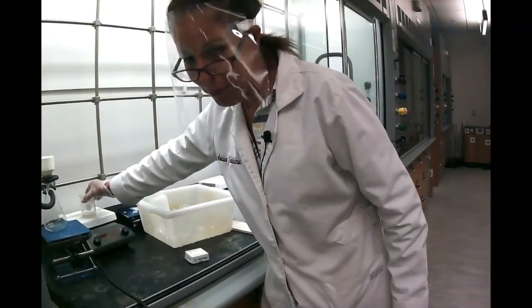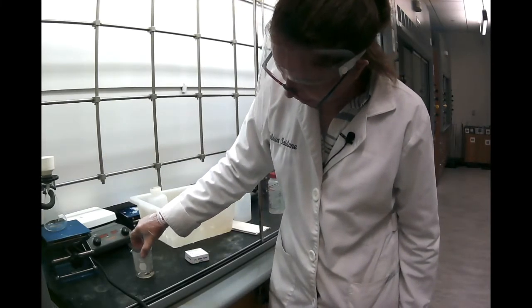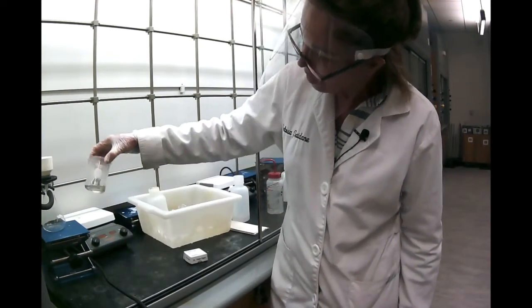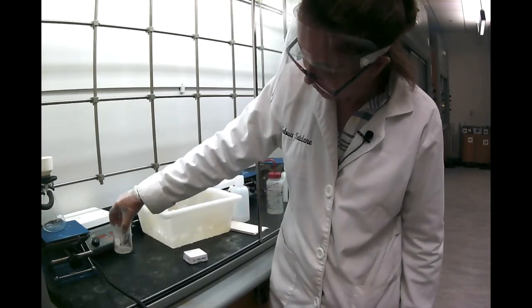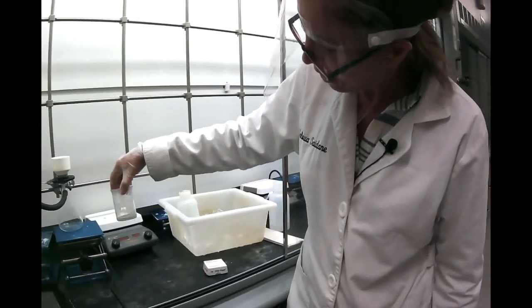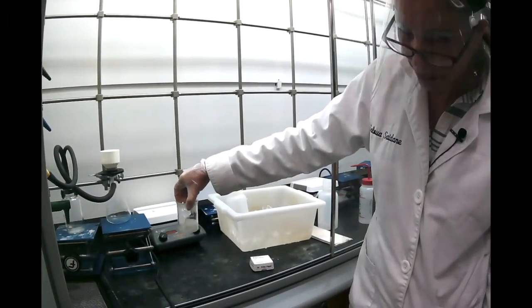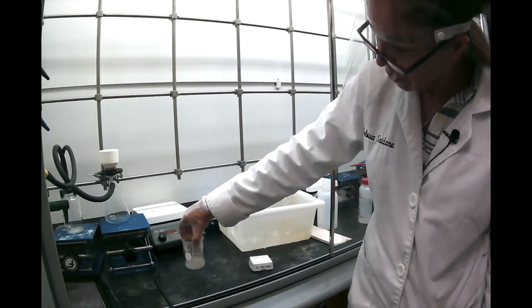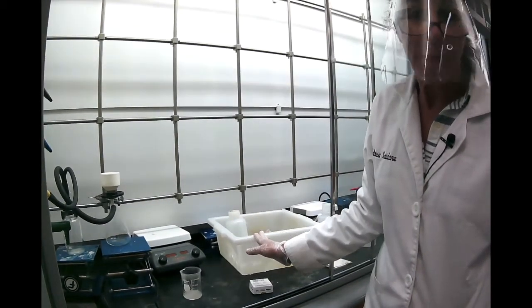Now that we evaporated half the water, you see the minute I put it on the bench and swirl a little bit, you start to see some crystals form, and I can see them right away. It looks slightly milky. That means you really evaporated all the possible water, so that's definitely a saturated solution. I'm swirling it a little bit to cool it off. First you cool it off at room temperature, and then you put it in an ice bath.